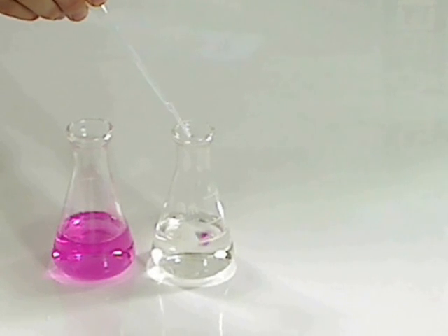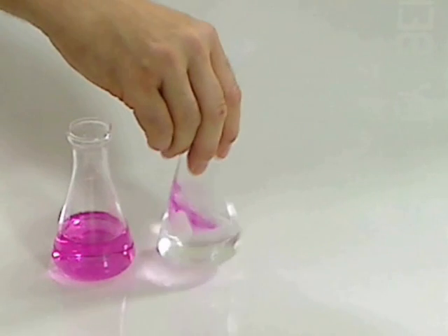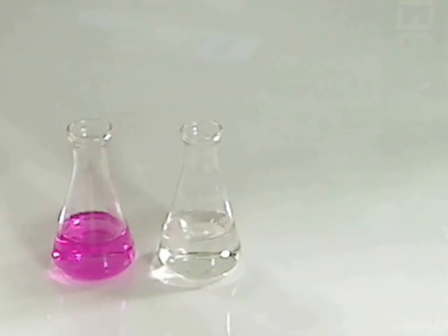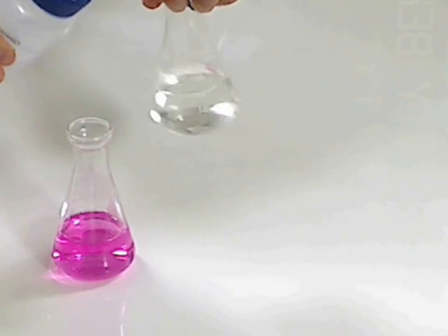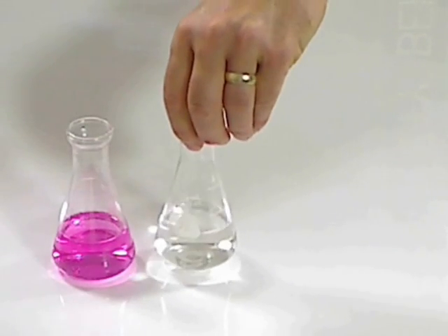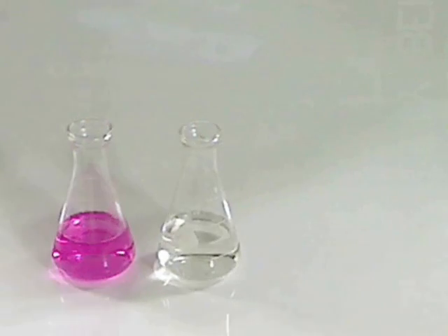Just a few more drops, I believe. Every once in a while, it's good practice to wash down the outsides of the Erlenmeyer flask with some DI water to make sure all the base gets in there.